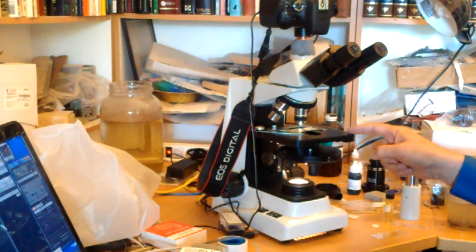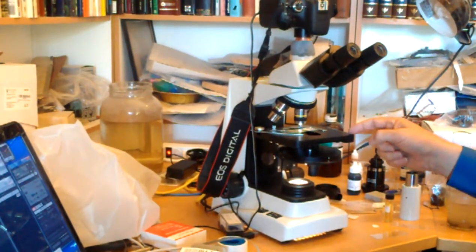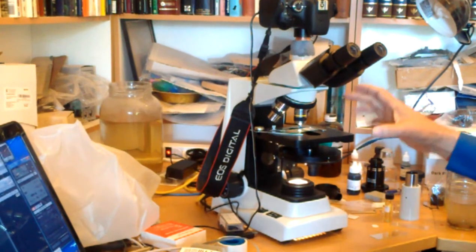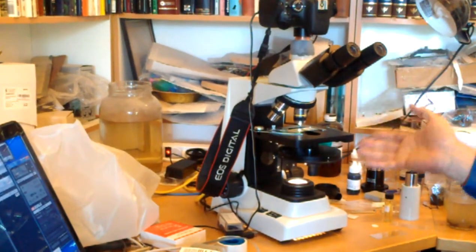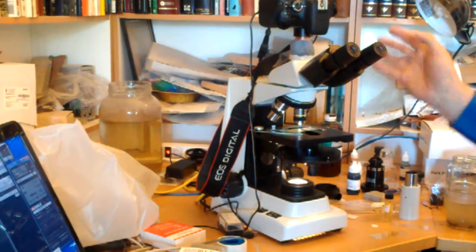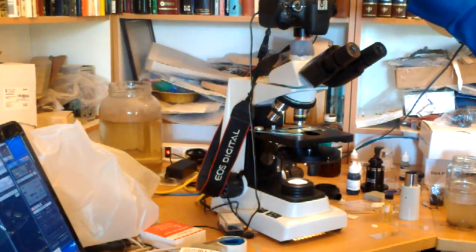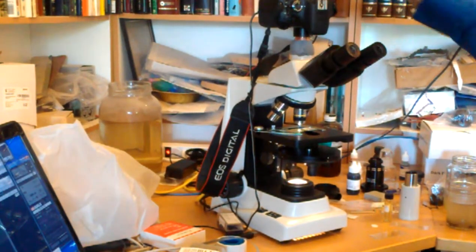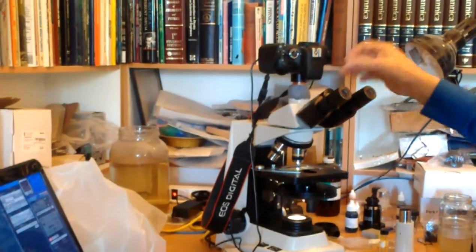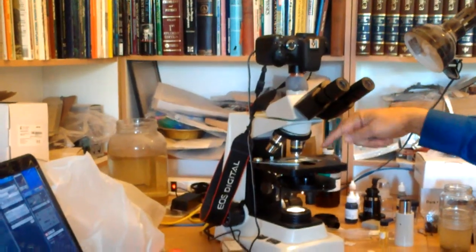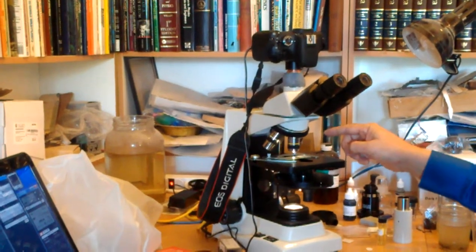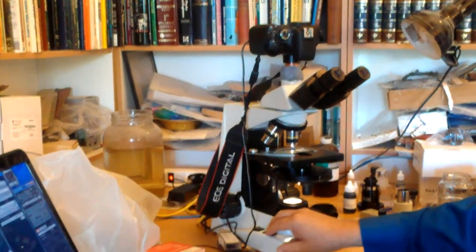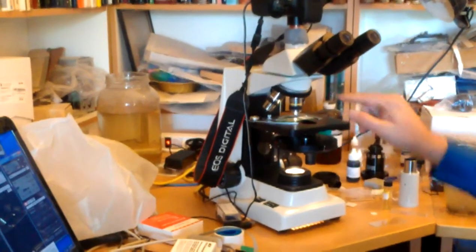Here we have a professional lab microscope. This does phase contrast and magnifications up to about 2,000 times. Here is a Canon T2i camera that's hooked up to the trinocular port, looking down. And what we've got here is the same slide of Tilia.